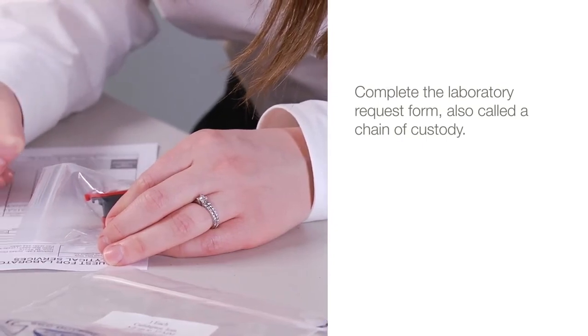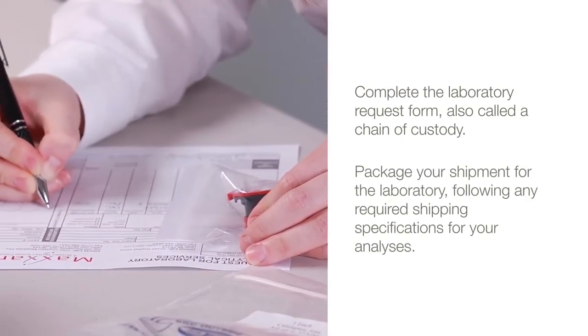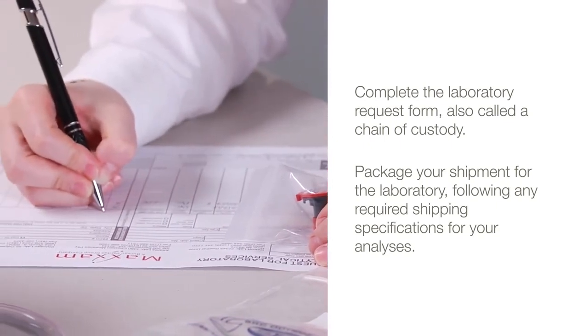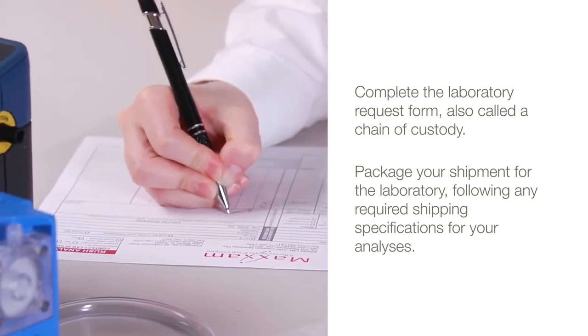Complete the laboratory request form, also called a chain of custody. Package your shipment for the laboratory following any required shipping specifications for your analyses, such as cold storage or holding time limitations.